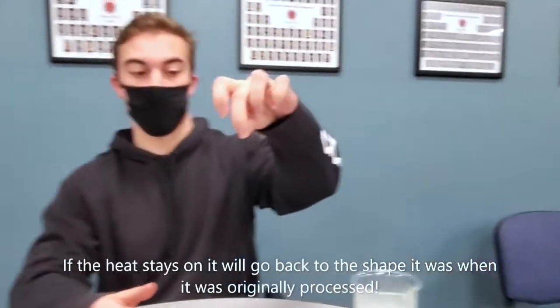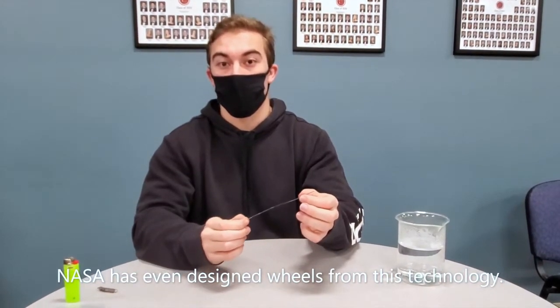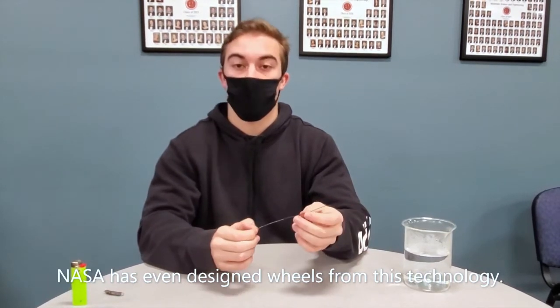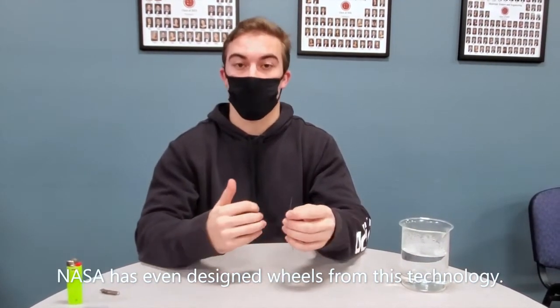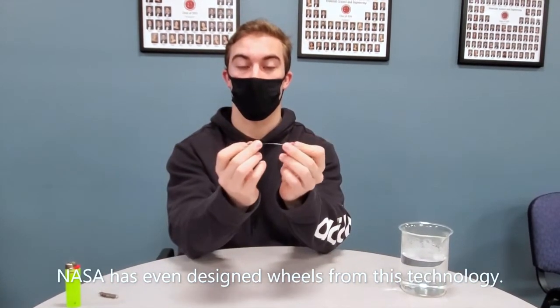And as you can see, it's nice. Once again, this is a nickel titanium alloy. It's a shape memory material, and this technology is also commonly found in braces. So they use this to straighten out your teeth. The increase in temperature in your mouth heats up the spring and causes your teeth to straighten out as well.